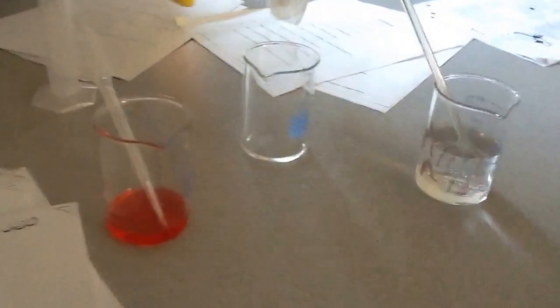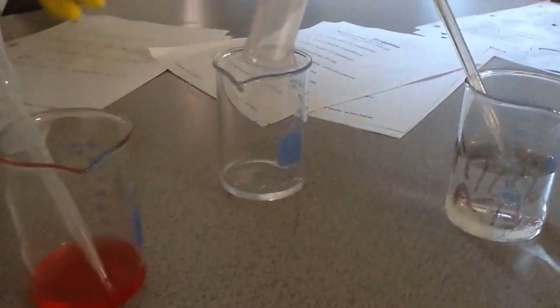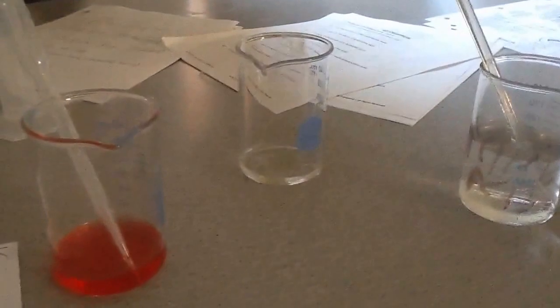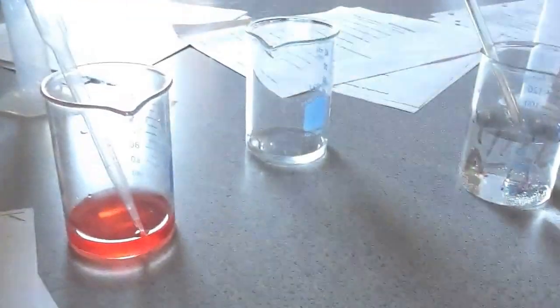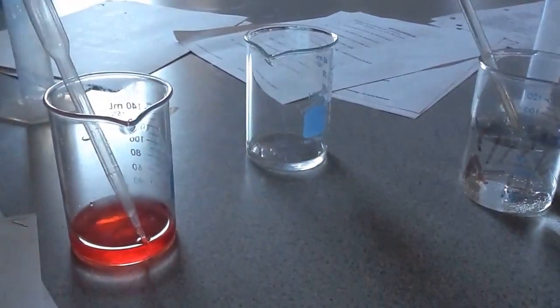These are both one molar, by the way. I calculated it out this morning. So here's our citric acid, five milliliters approximately of one molar. I'm going to add my base to the acid. You notice right now it's clear.